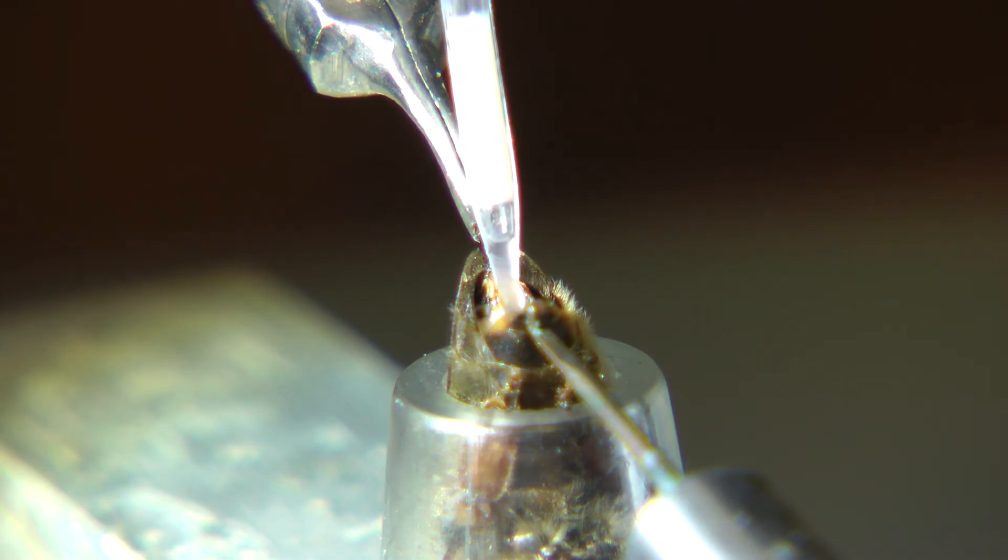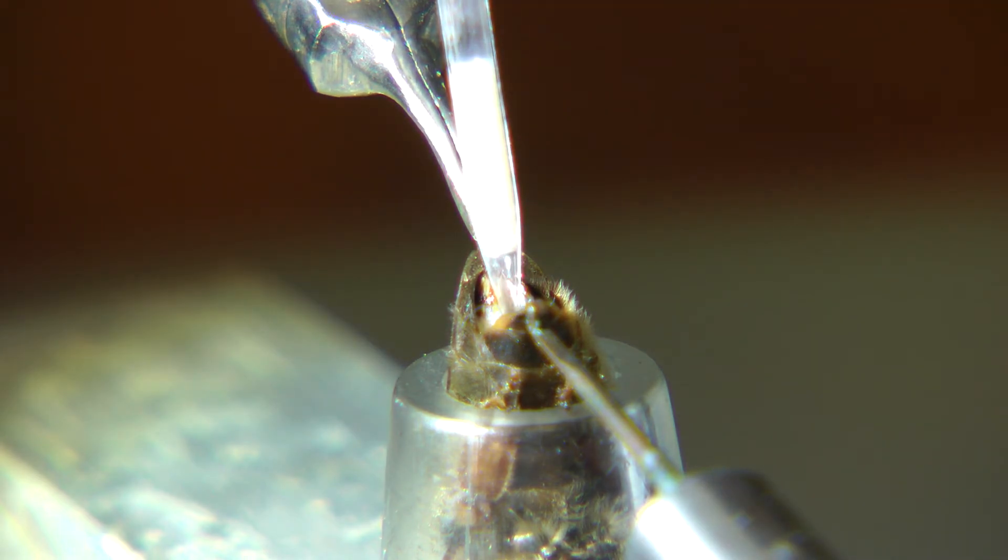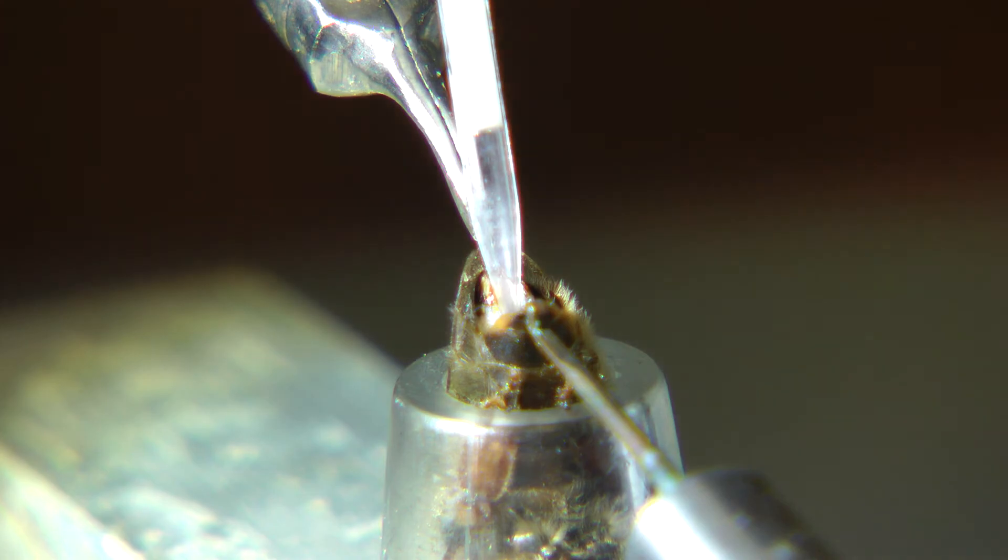That's not right. I don't know. Maybe it is. Yeah, there it is. Okay, there's that one.